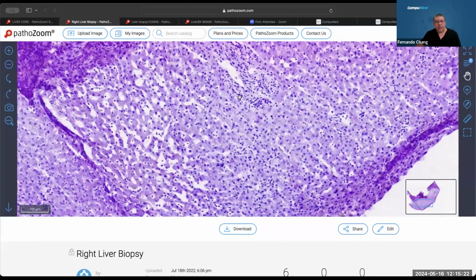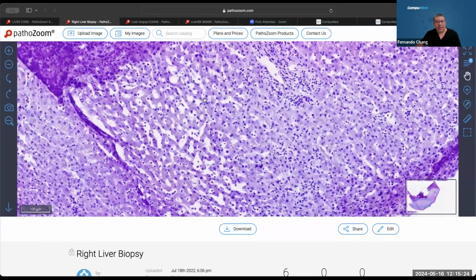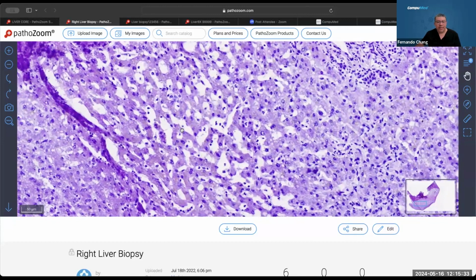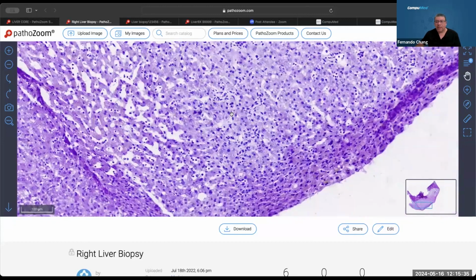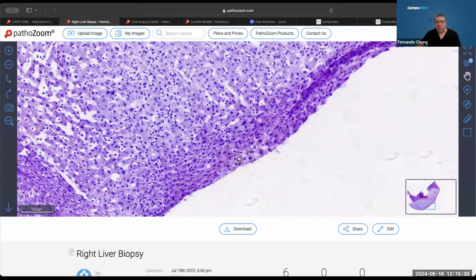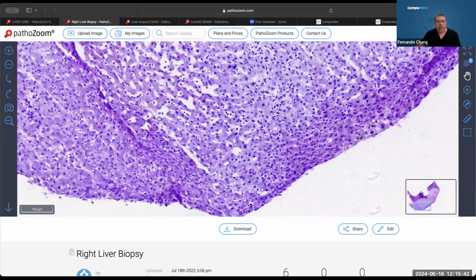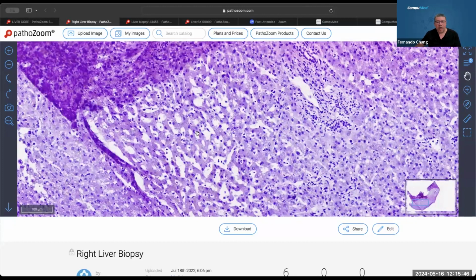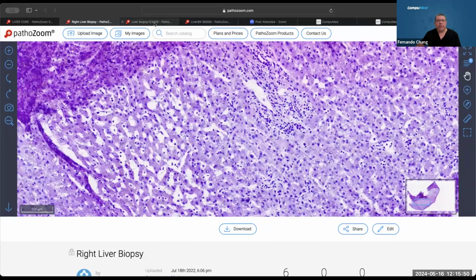And that's the reason why I chose that. So this is not actually steatosis. This is actually freezing artifact, the bubble type freezing artifact happening in these areas. In comparison to this other one that's less than that, and this one's a little hemosiderin probably around, but you can observe in this area a lot of this bubbling effect. Okay, I'm going to go to the next one.